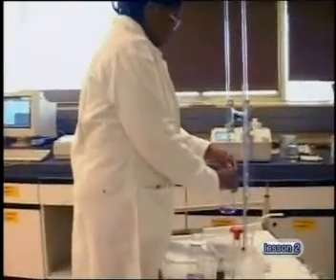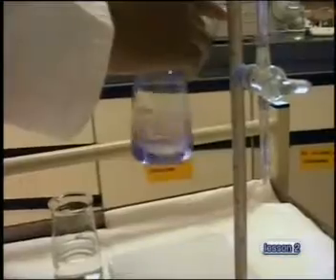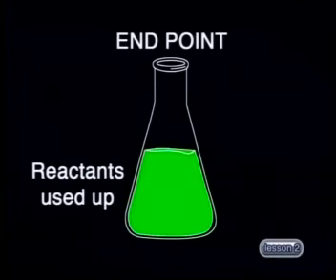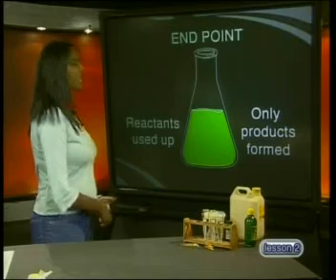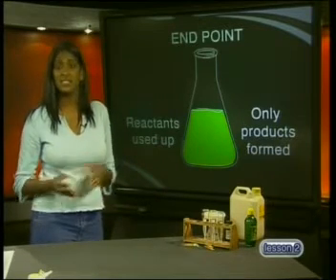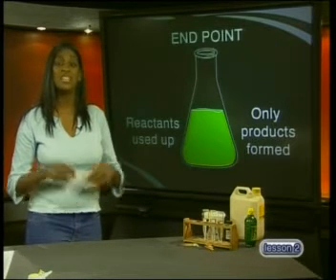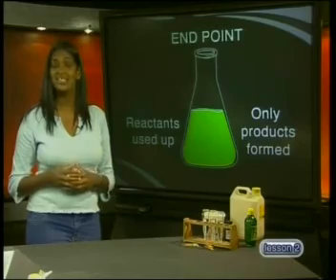There are some important facts to note from that demonstration. When exactly the right amount of acid was added to the base, the chemical indicator changed color. At this point, the acid has exactly neutralized the alkali. This is called the end point of a titration. The end point is when the reactants have been used up and only products are formed. When doing a titration with an indicator, the point at which one drop of acid causes a change in the color of the indicator is taken as the end point.